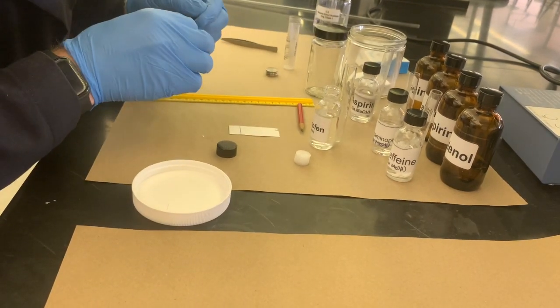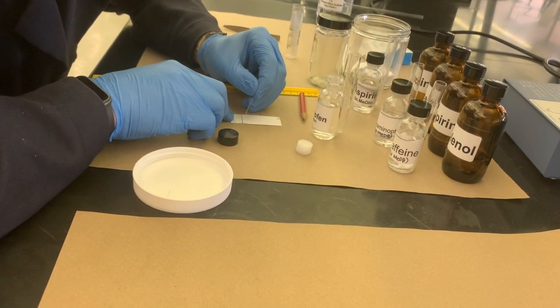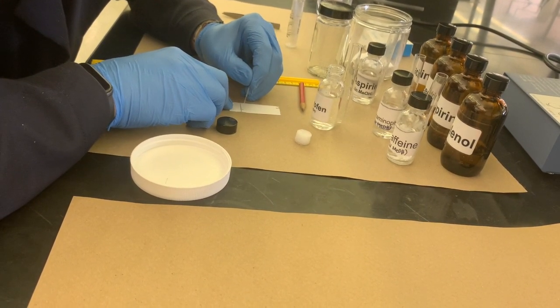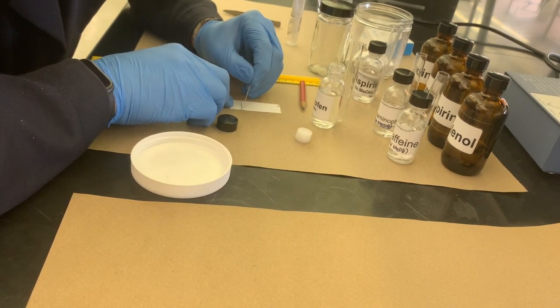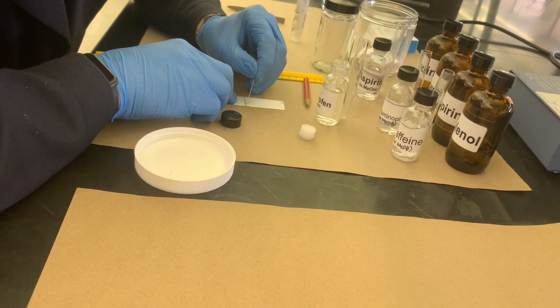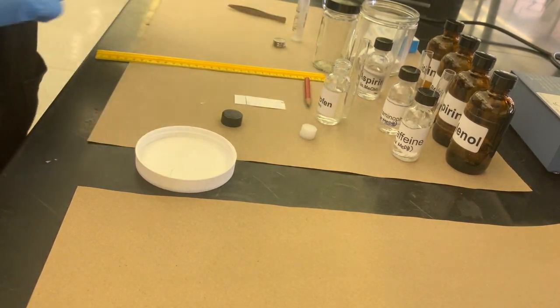So if you remember what I said about correcting your samples, just try to make sure that you put them at the same even level on the plate where they finally end up getting spotted. It's good to keep a good amount of distance between the two because any overlap will be a serious problem. Don't allow the spot that the material is moving out to become too big. You want it to be a nice little spot at the starting line.